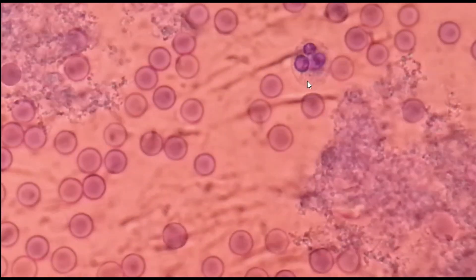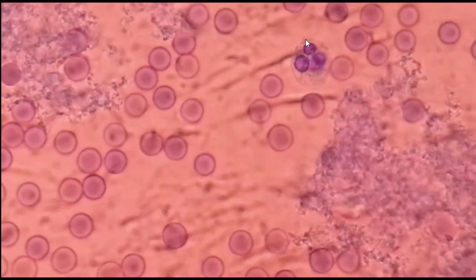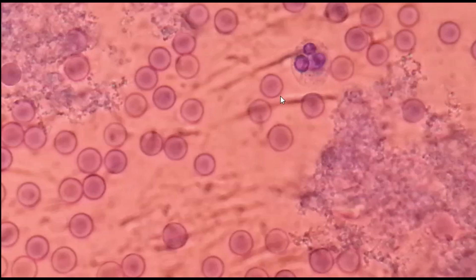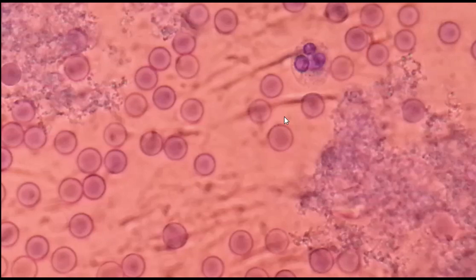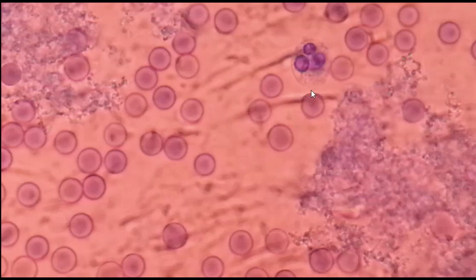White blood cells are encountered rarely, so this one is the white blood cell — after searching many fields we found it.